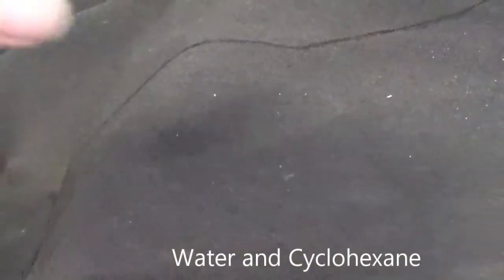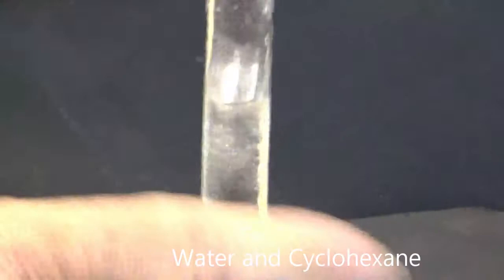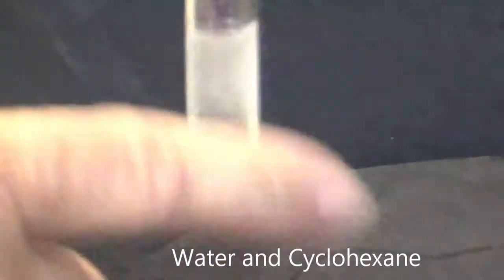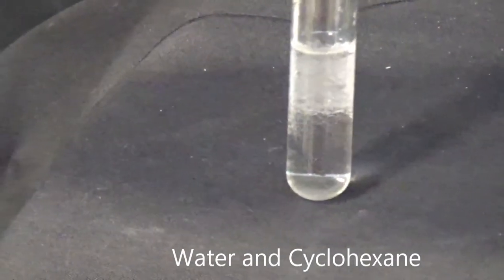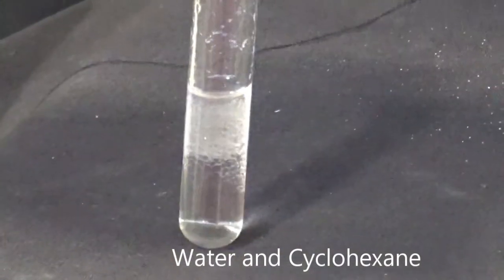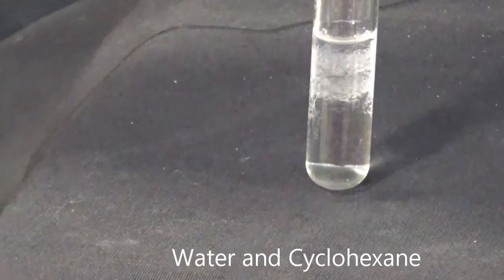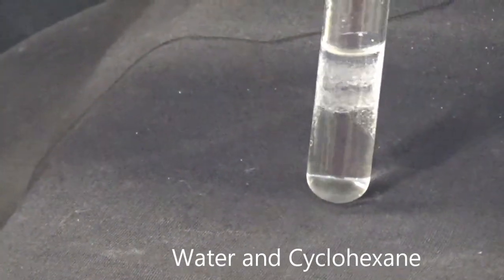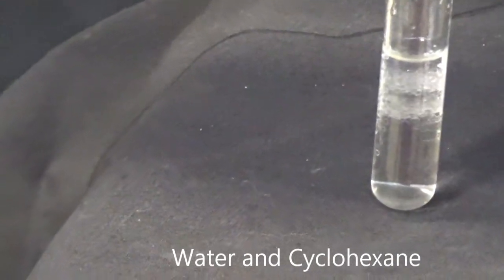I'm going to mix it up a little bit. Let's see what I get. What do you notice happening here? Let's let it settle a little bit. It takes a little patience sometimes.